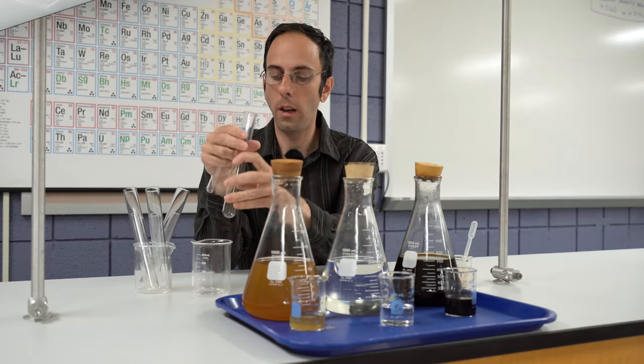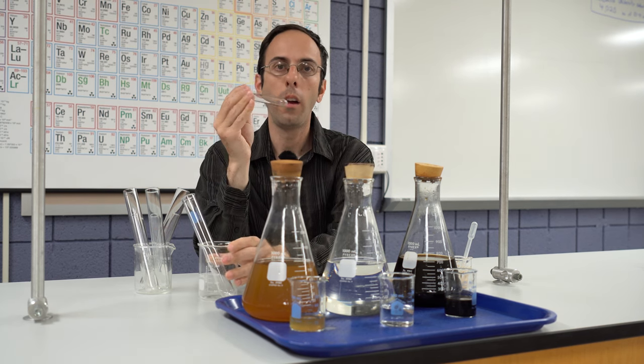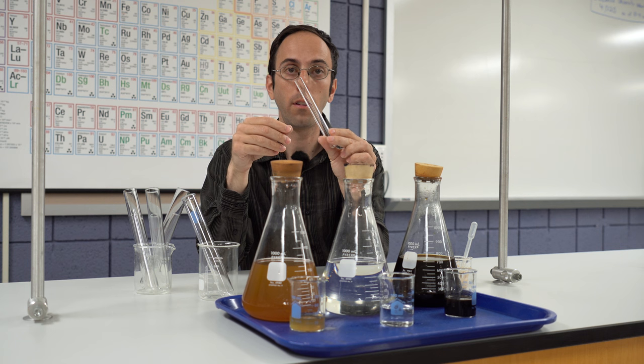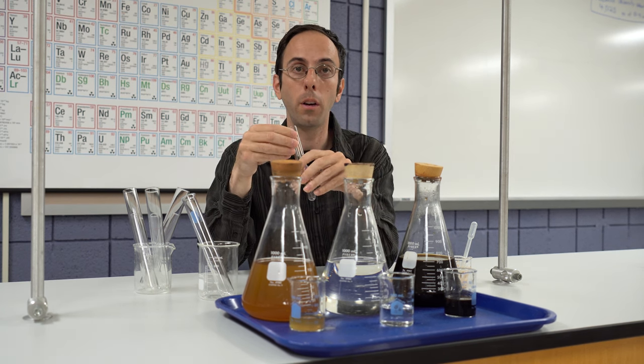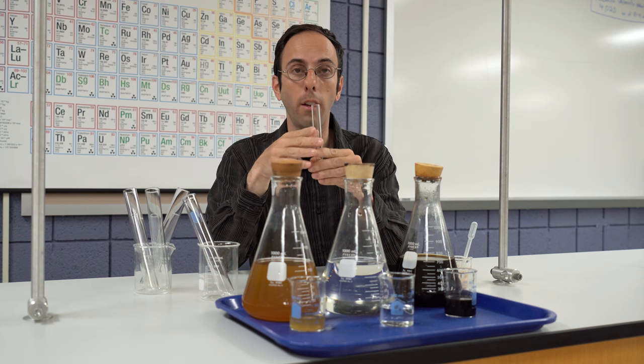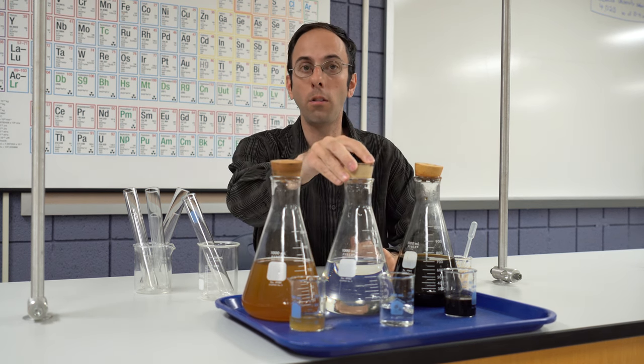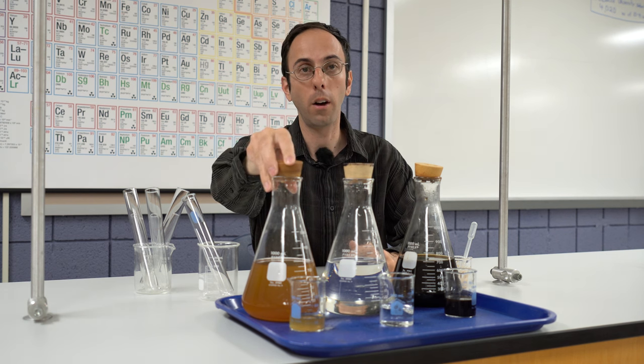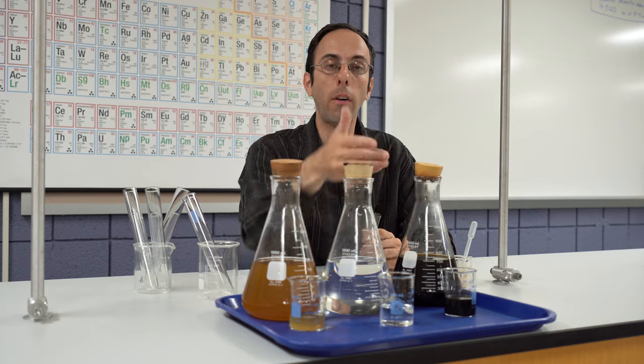We're going to take our large beakers, this is going to hold everything. Be careful, this is all glassware. I have one of the small test tubes. Measuring the exact amount of liquid isn't that important, but we want to make sure we're going to fill this up. I have molasses, regular refined sucrose or sugar, and then I have honey. Each of these are a 20% solution. So I've allocated them out into small beakers here.